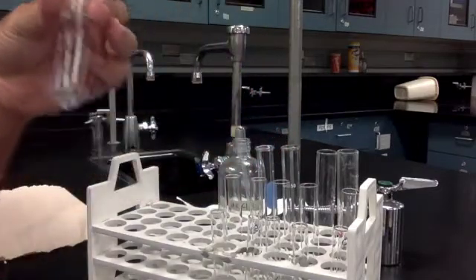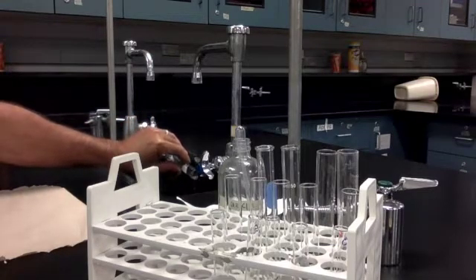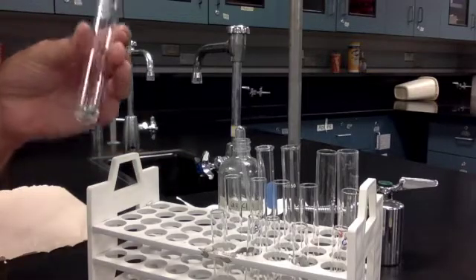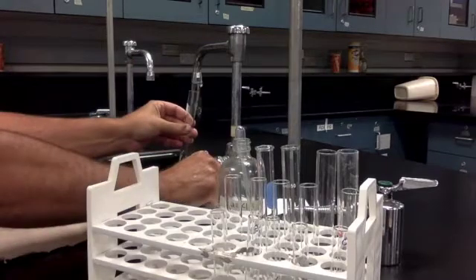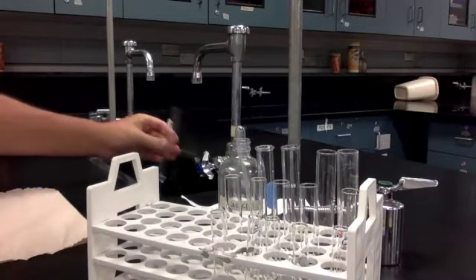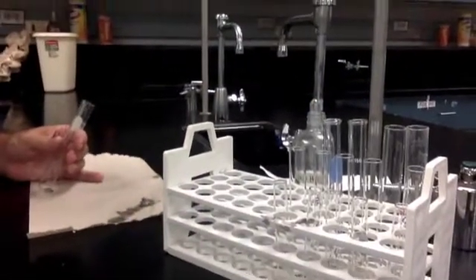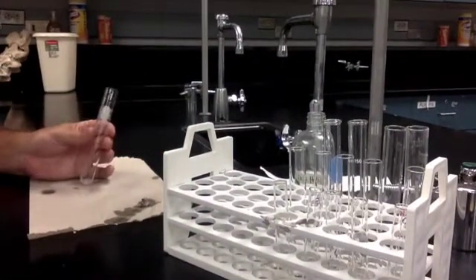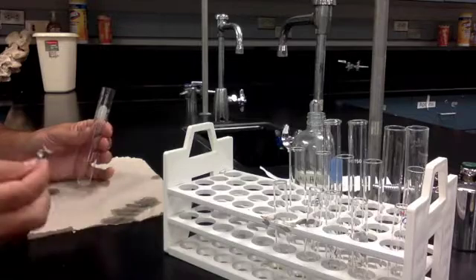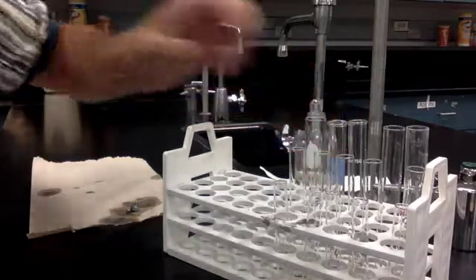I'm going to pour off the liquid, but I'm not going to pour the zinc down the sink. We don't want zinc in the sink. Zinc will clog up our sink. So there's still a little bit of acid there, but if you run some more water in there, do that a couple of times, pouring carefully off the water, you are decanting. Then you can put the wet zinc on a paper towel to dry. So you just pour it out on the paper towel to dry. So you've washed off the acid, you've washed that acid down the sink, and now your zinc can dry out and be used again by another group, whatever amount of zinc is left there.